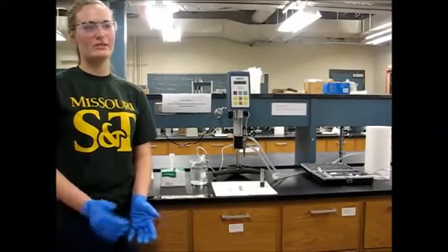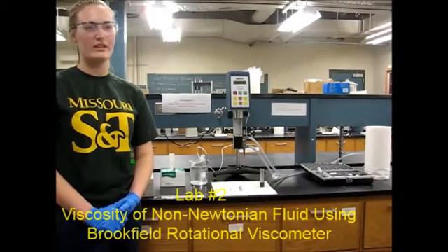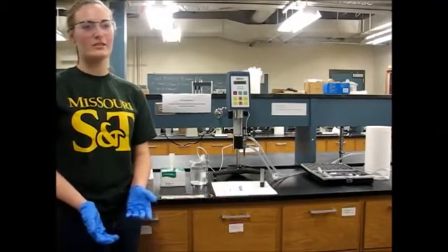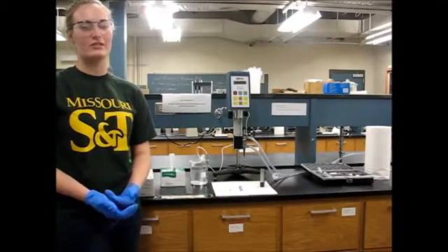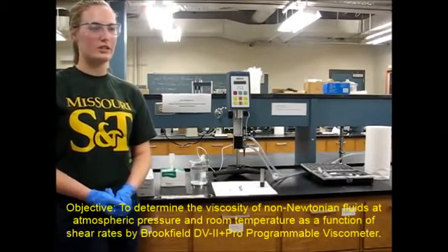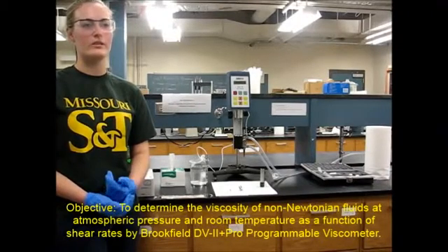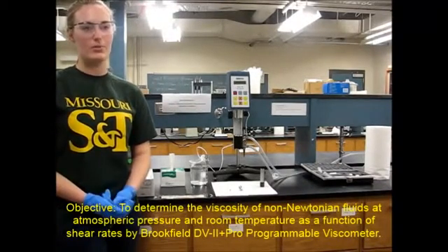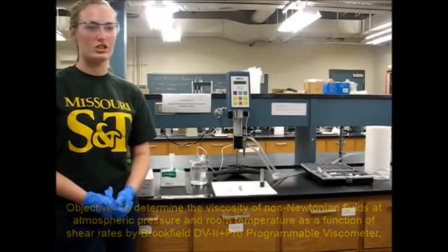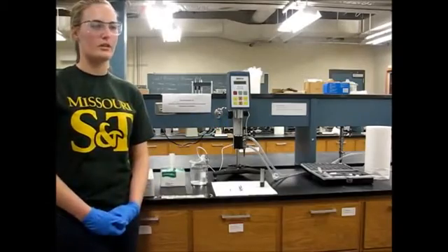Welcome to Lab 2: Viscosity of Non-Newtonian Fluid Using the Brookfield Rotational Viscometer. As we know, fluid viscosity is defined as the internal resistance to fluid flow. The objective of Lab 2 is to determine the viscosity of a non-Newtonian fluid at atmospheric pressure and room temperature as a function of shear rates using the Brookfield programmable viscometer.